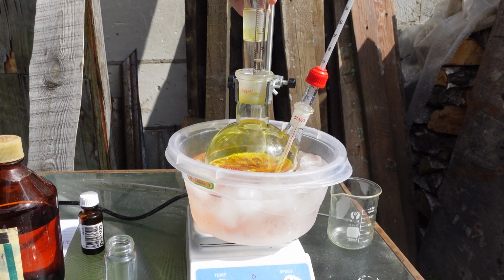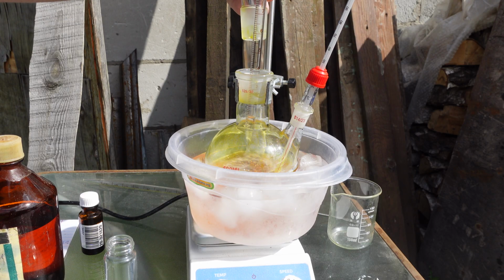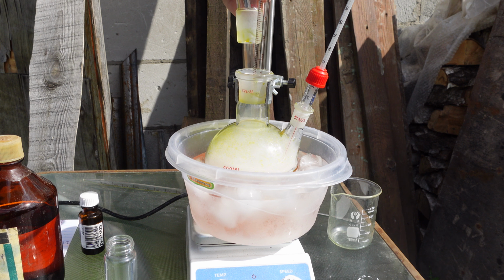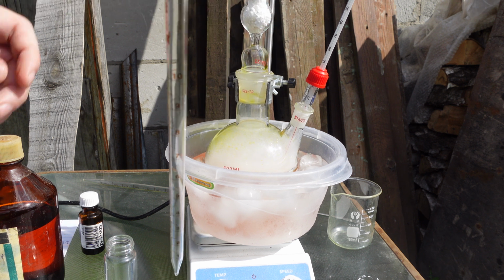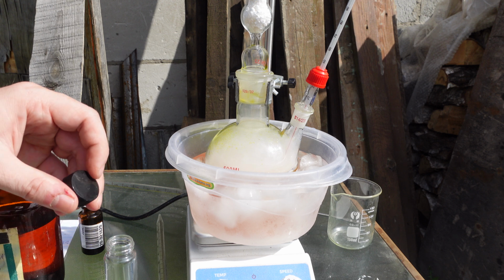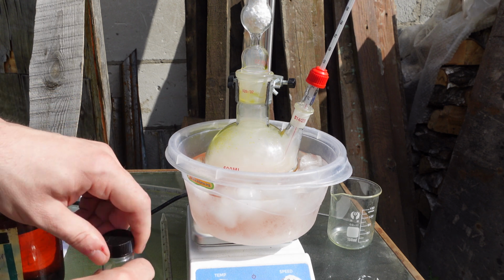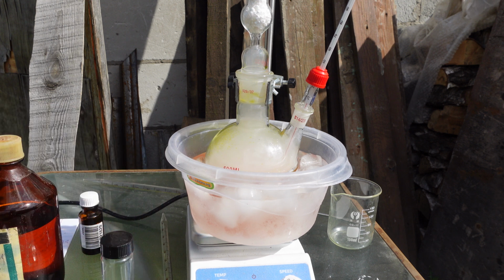The product is almost insoluble in dichloromethane and should start precipitating immediately. However, nothing precipitated for me until I had added 2/3 of the total oxalyl chloride. This could only mean one thing: water in the dichloromethane and possibly water in the triethylamine. And everything that happened up to that point was the reaction of oxalyl chloride with water. We were just drying the reaction mixture in such an expensive way.